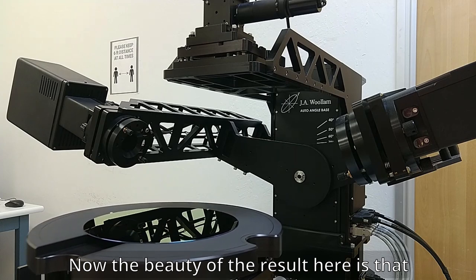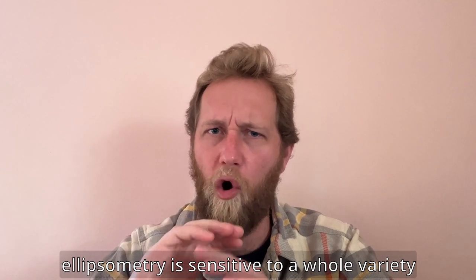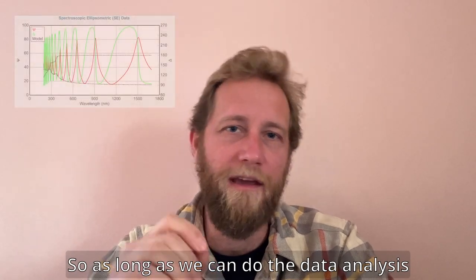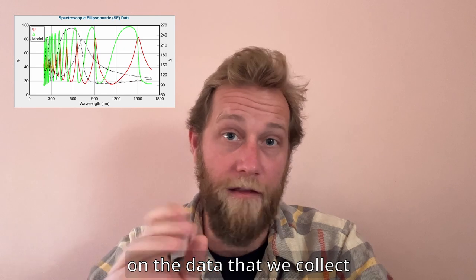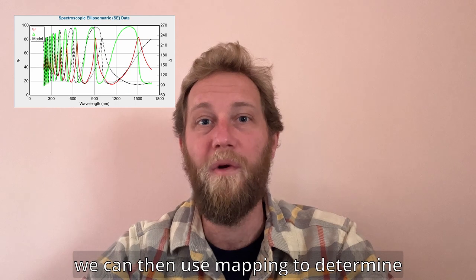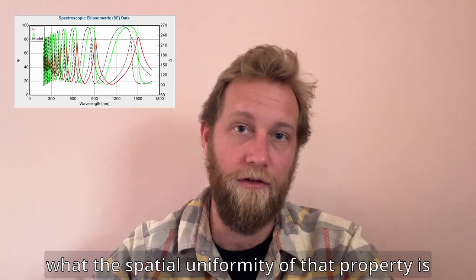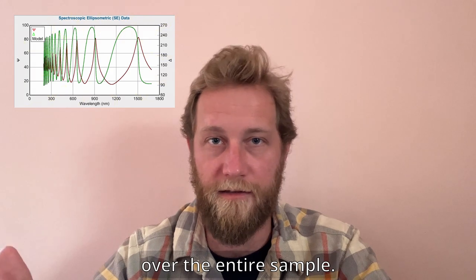The beauty of the result here is that ellipsometry is sensitive to a whole variety of material properties. So as long as we can do the data analysis on the data we collect with a model that's sensitive to any property we want to measure, we can use mapping to determine what the spatial uniformity of that property is over the entire sample.